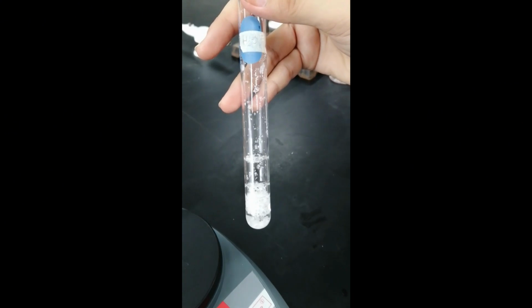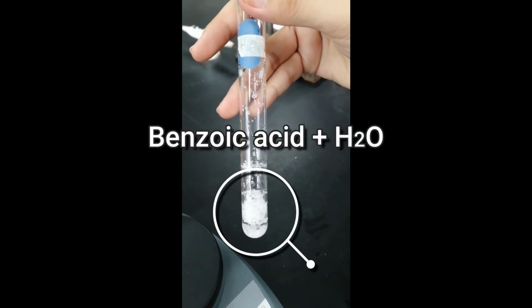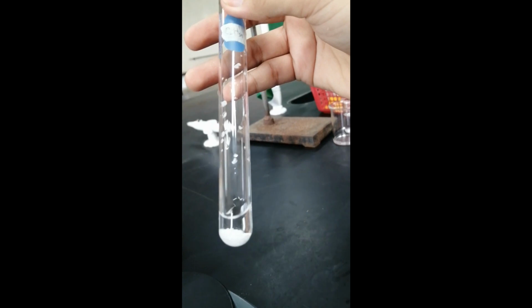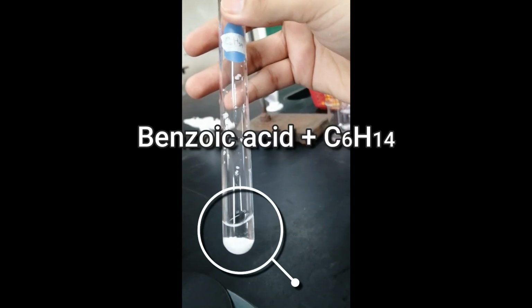Na-dissolve siya completely. So, this is the result kapag si benzoic acid is dissolved in water. Hindi siya na-dissolve. Compare mo kay water. Yan yung result pag si benzoic acid is dissolved in hexane.